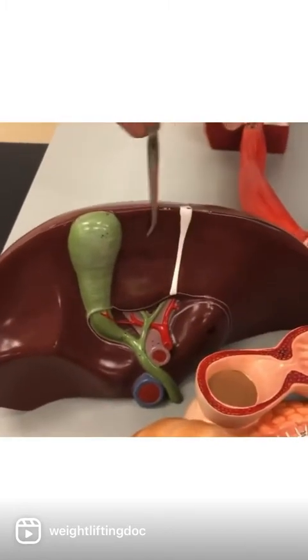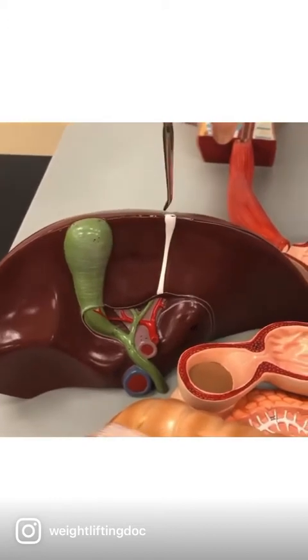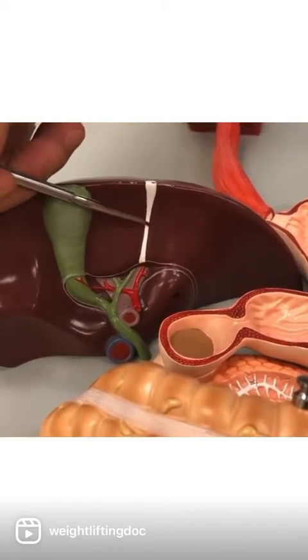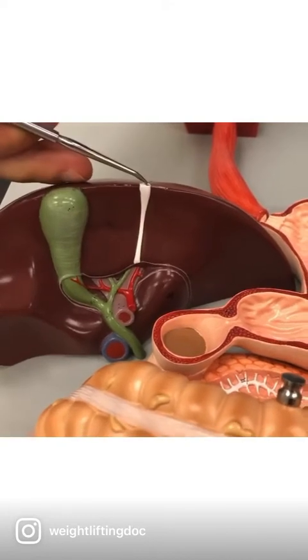There's another lobe in between here, right next to the gallbladder, and I always look at it and say, well, it's got like 4 sides to it. And quad means 4. So this is the quadrate lobe of the liver. This ligament on the bottom here coming out in the front is called the ligamentum teres.